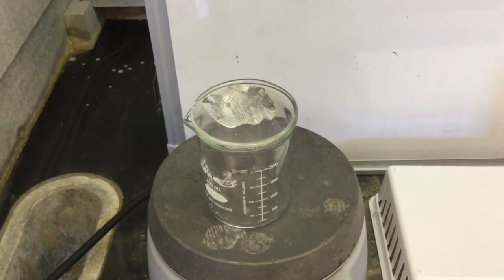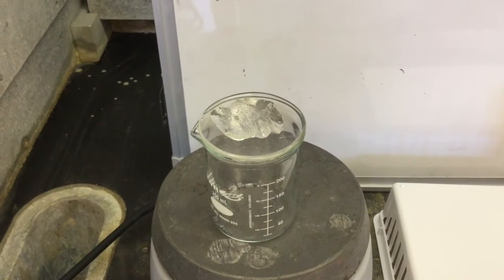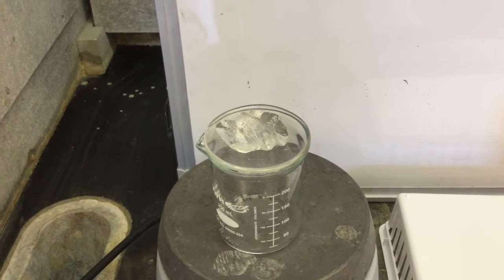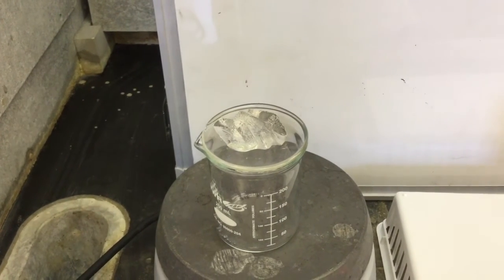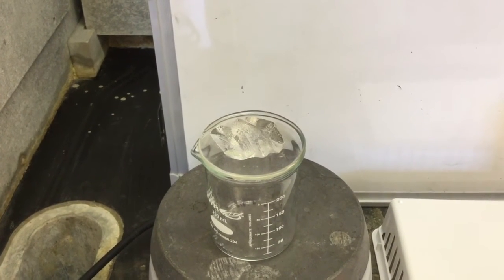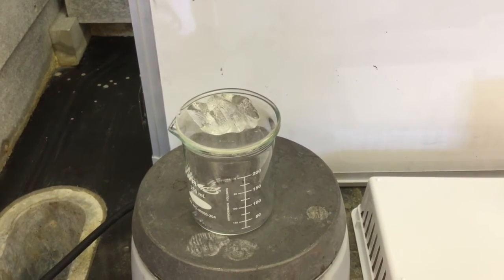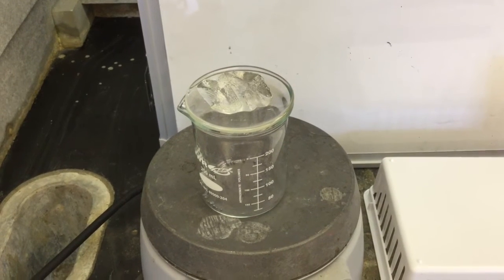You will notice a color in the glass as it is vaporized. The ice will cause the vapors to redeposit on the underside of the watch glass. After you have observed for several minutes, you will remove the ice and the watch glass and observe the underside of the watch glass to look for redeposition. Think about whether these changes indicate that this is a physical or a chemical change.